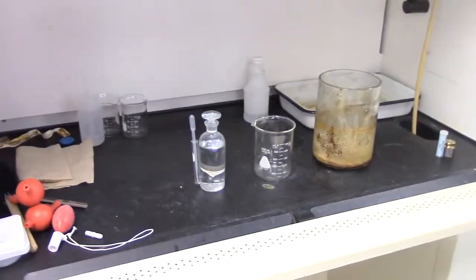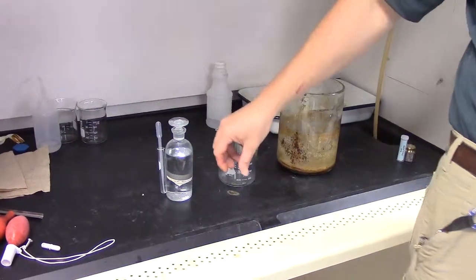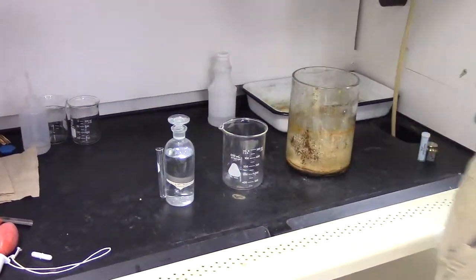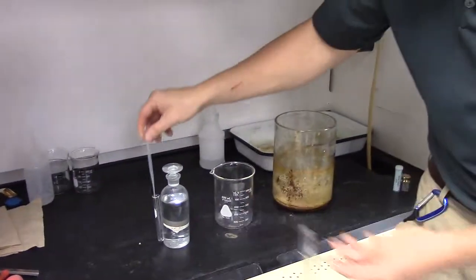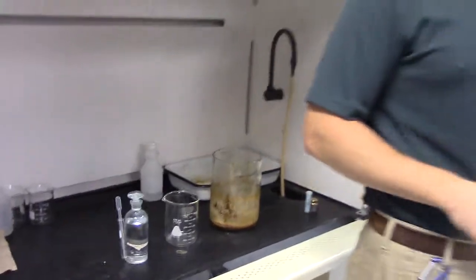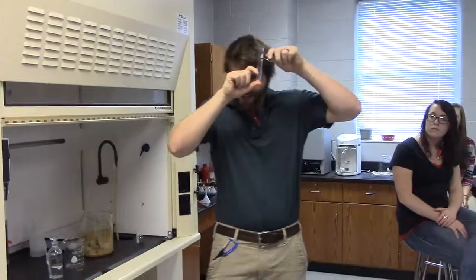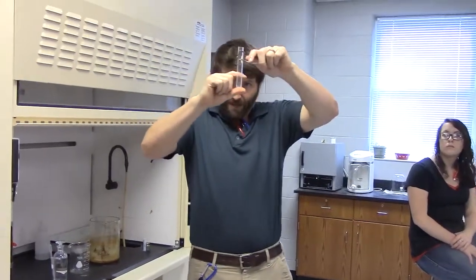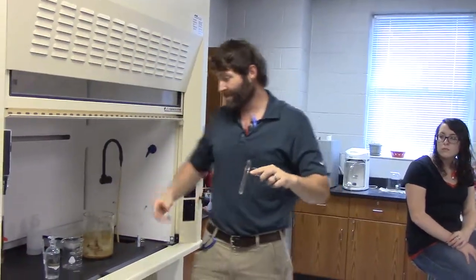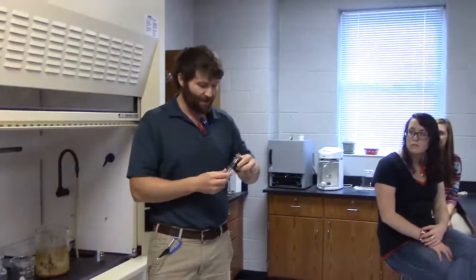I'm going to turn off the hood so you can hear right now. You need to take the top off the HCl, and there's a pipette on the side of it. And what you can do is use the pipette to reach inside, and you're going to be like, how much HCl do we get? I'm about to blow your mind. About this much. In other words, I'm not telling you an exact amount. All we're going to use this for is cleaning. So I'm going to get about that much in there. Now, for the sake of this lab, I'm not going to get the actual HCl out because I don't want to have to dispose of it.